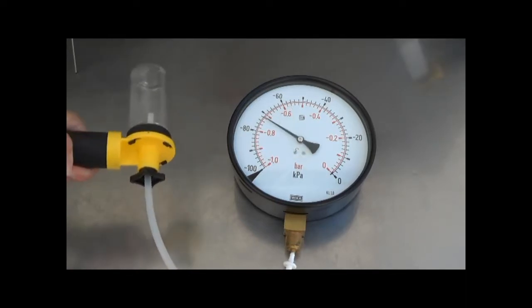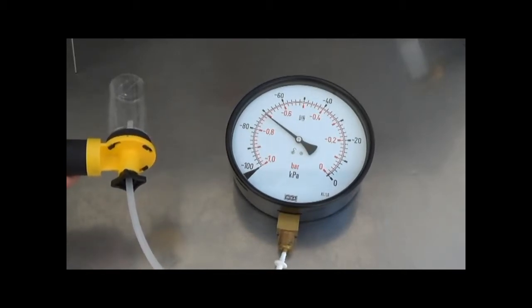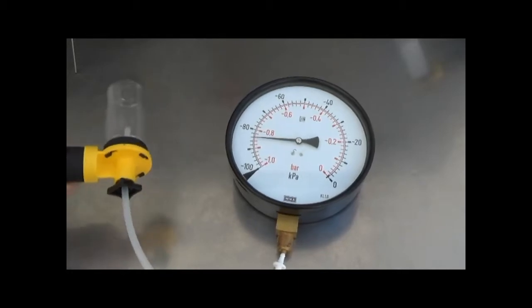Three strokes would give you 70% if you pump fast so the bottle doesn't start to fill before you have finished the pumping action.